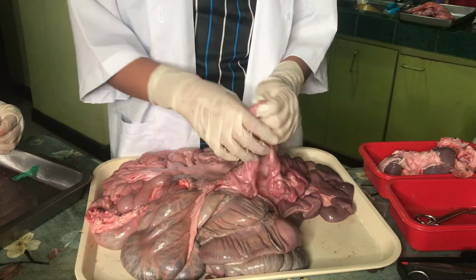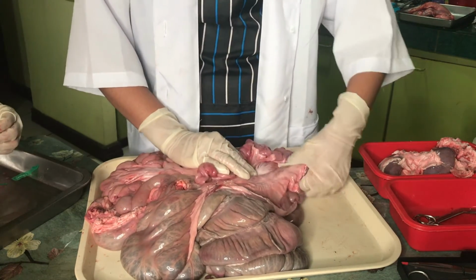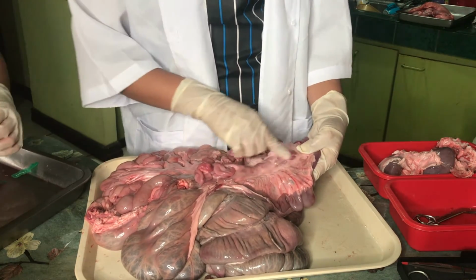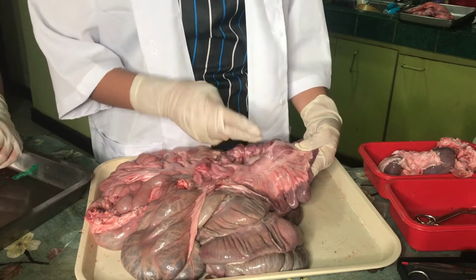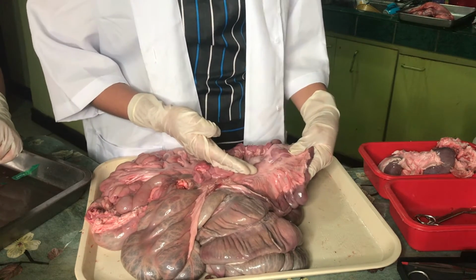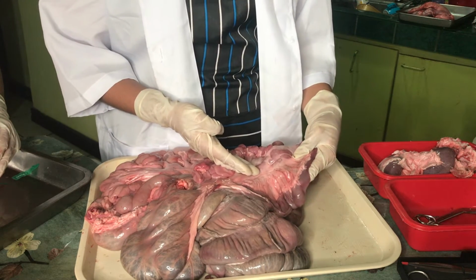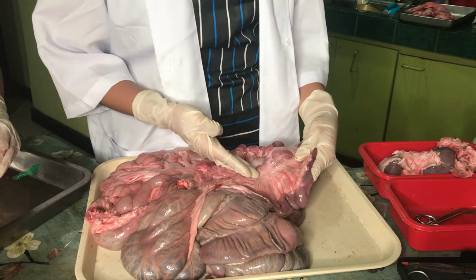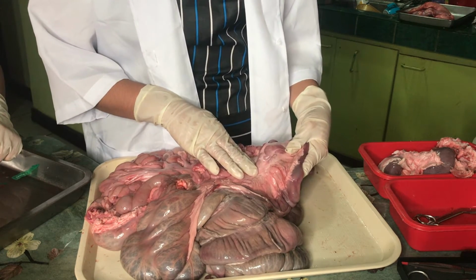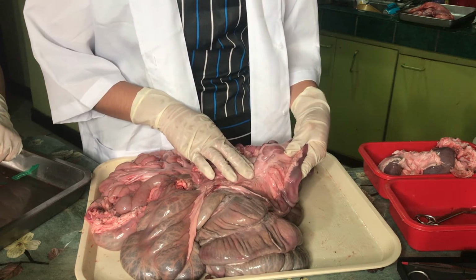So our mesentery also contains lymph nodes, this one. Lymph nodes are small glands located throughout your body that can help fight off infections. They can contain several types of immune cells and can trap pathogens such as viruses and bacteria. Lymph nodes in the mesentery can sample bacteria from your intestines and generate an immune response when necessary.